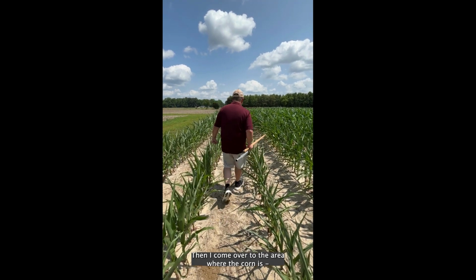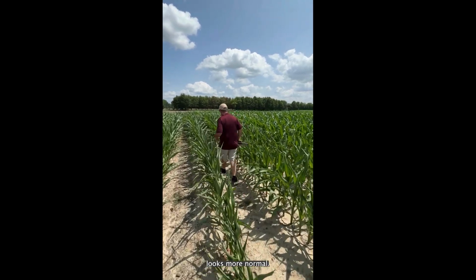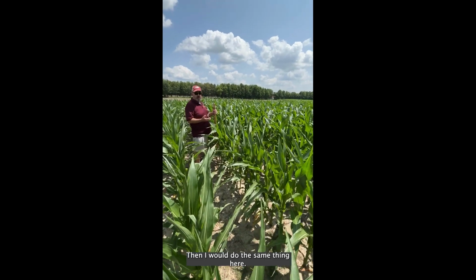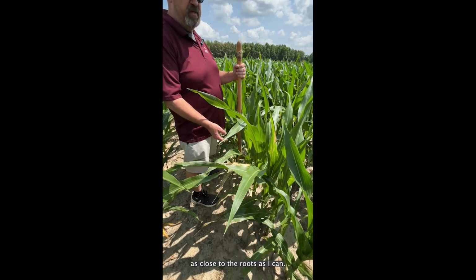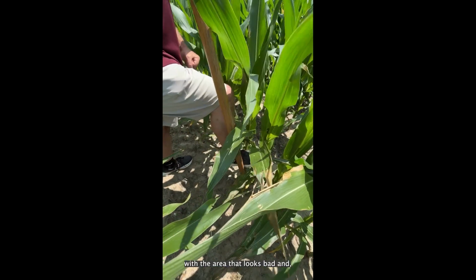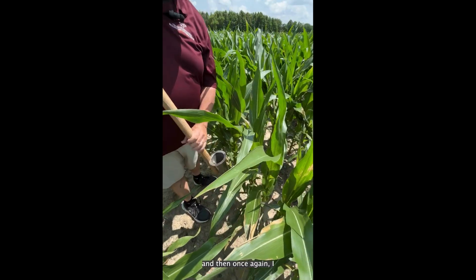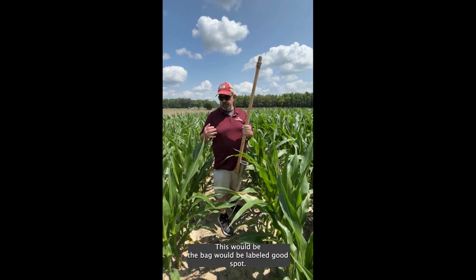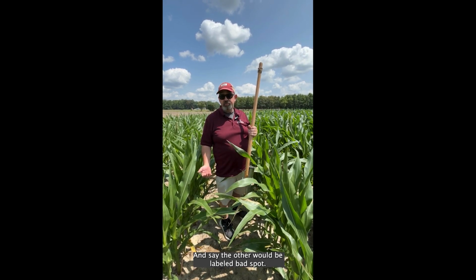Then I come over to the area where the corn looks more normal, and I would do the same thing here. I take the soil samples from in between the plants as close to the roots as I can, just like I did with the area that looks bad, and then once again I dump that sample into a bag, and I label the bags. This bag would be labeled good spot, and say the other one would be labeled bad spot.